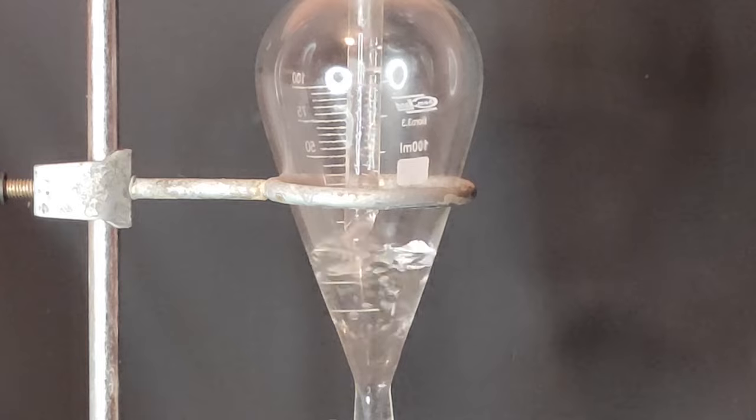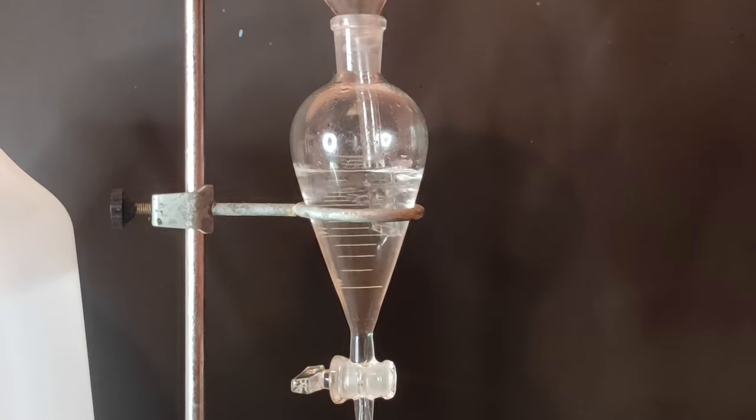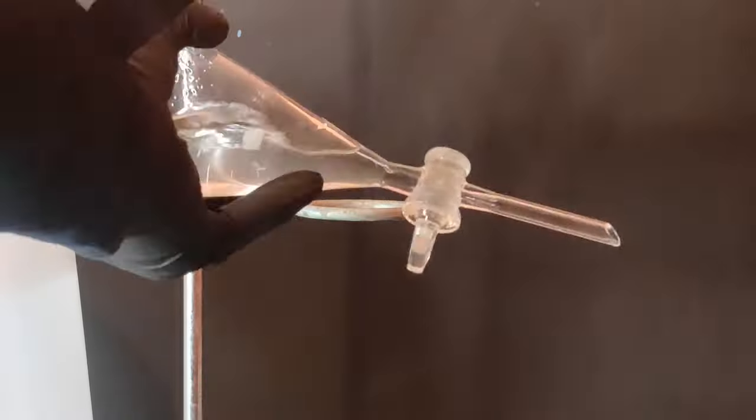To a separatory funnel I've added the nicotine water solution, and then I've added around 20ml of diethyl ether. Then the separatory funnel was capped and shaken.